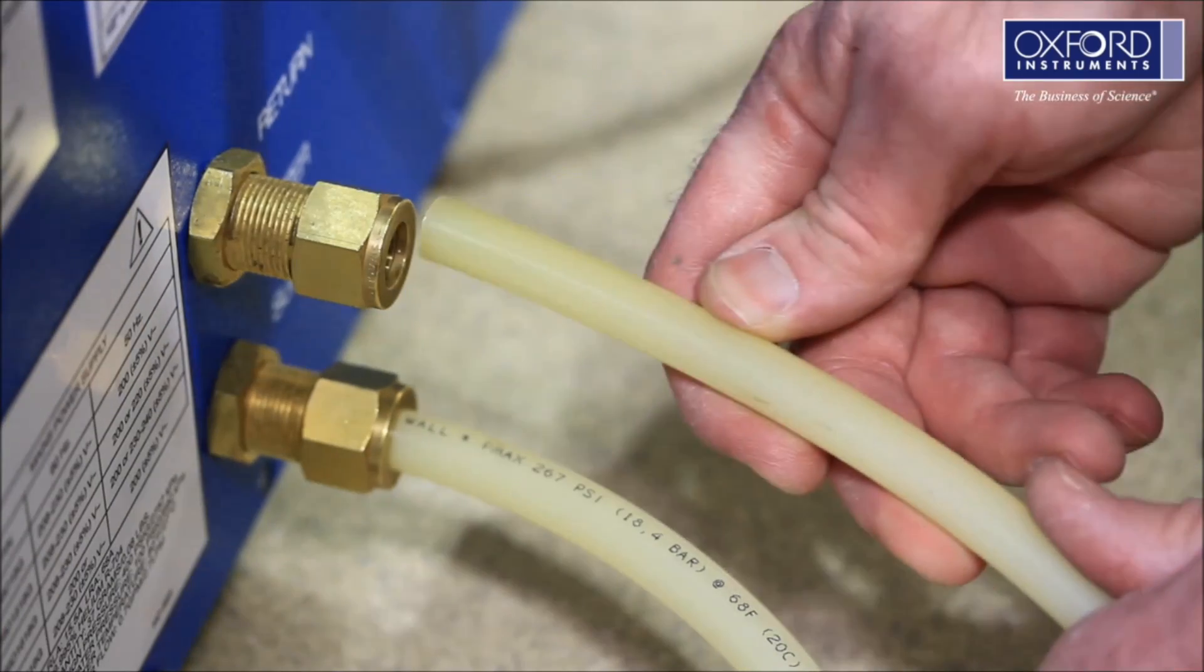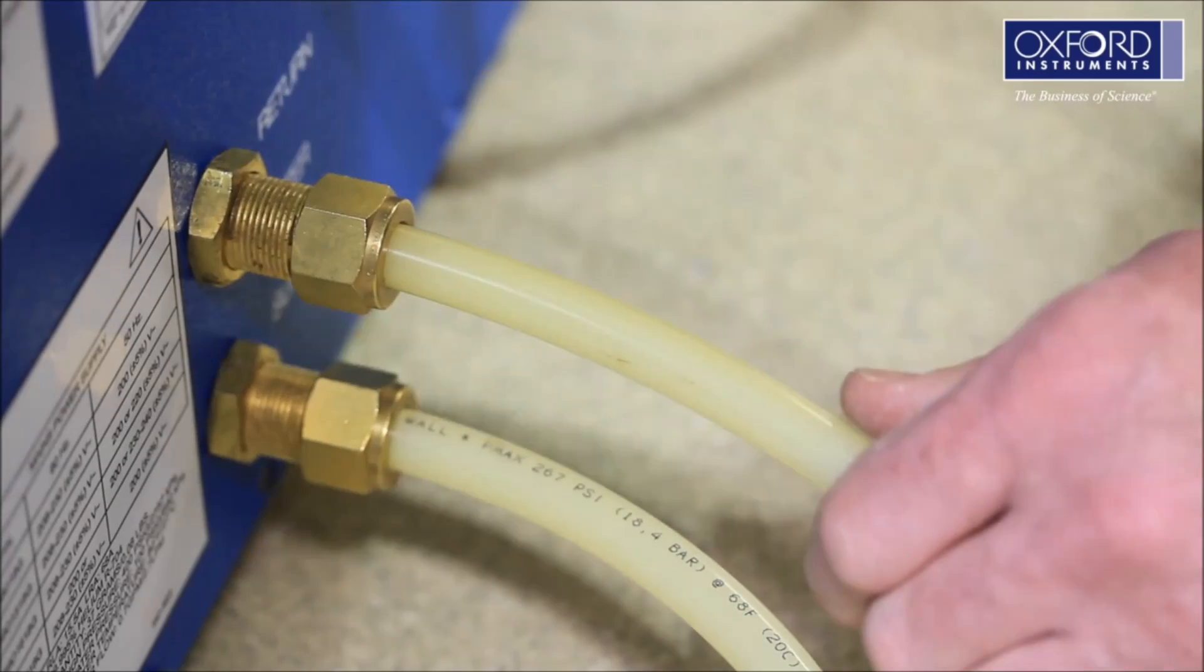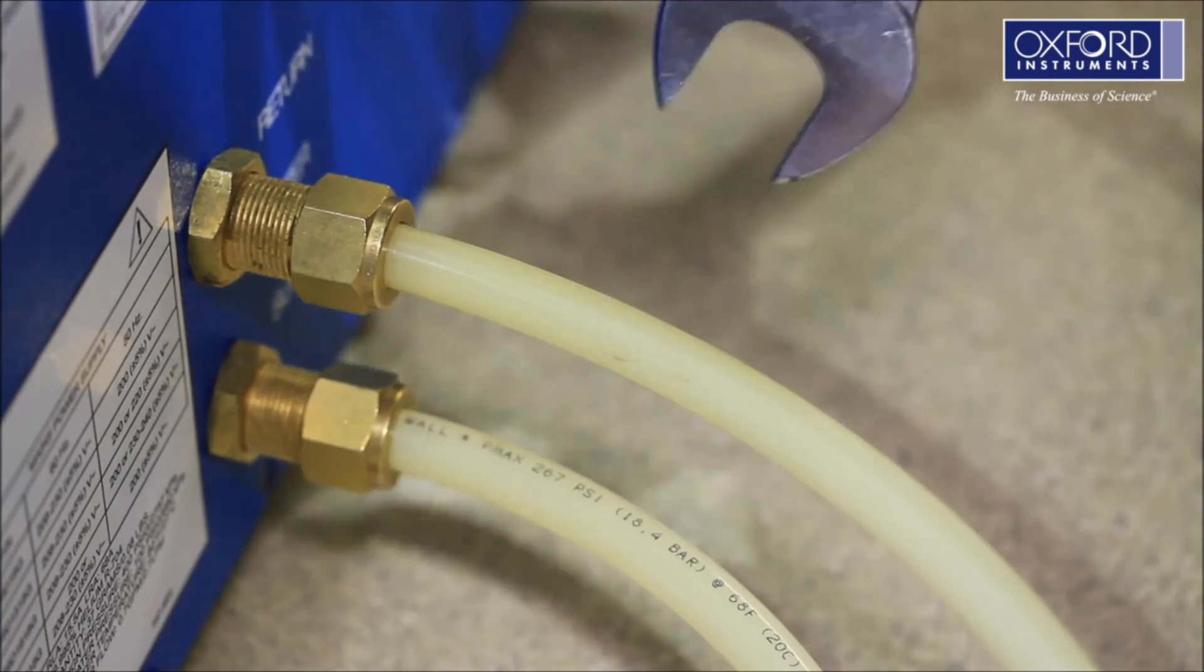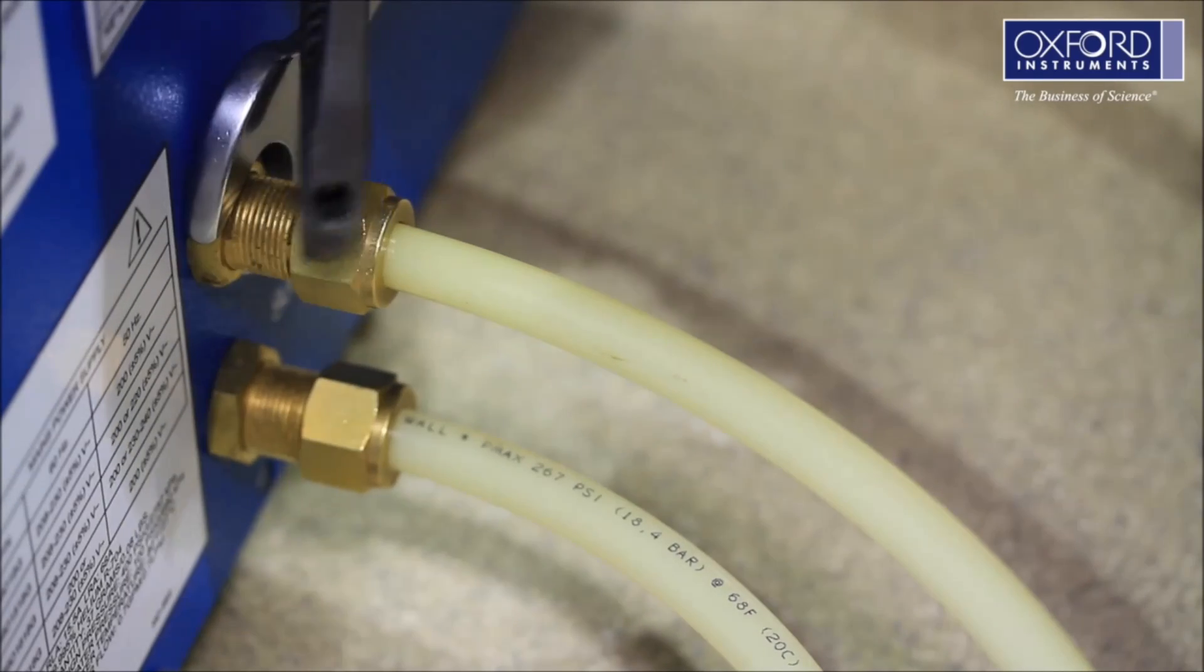You must provide suitable cooling water for the compressor. Make the water fittings at the compressor. Ensure you use two spanners to tighten the fittings.